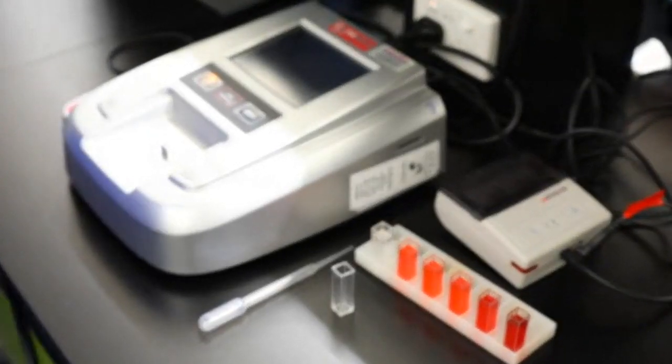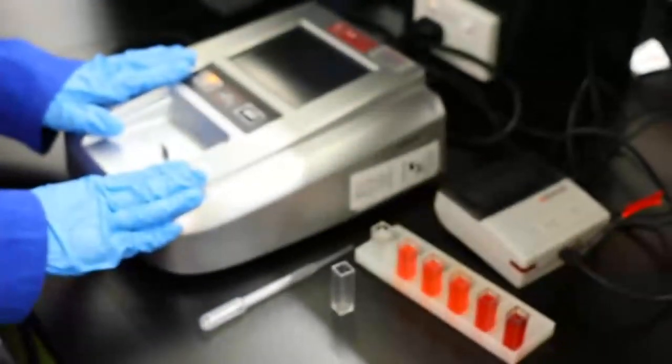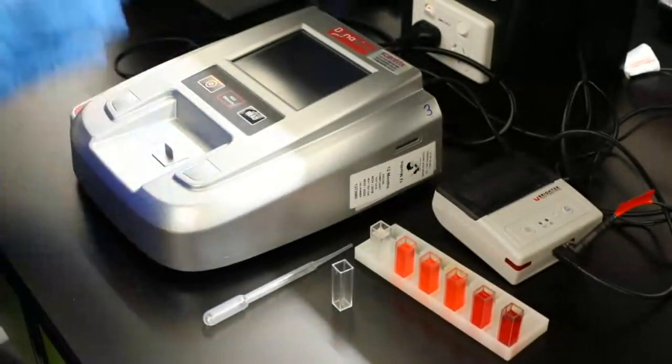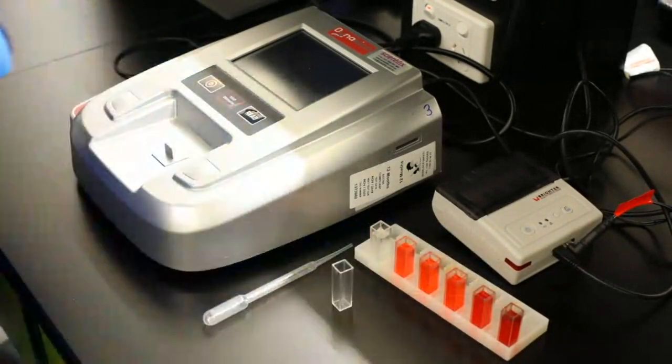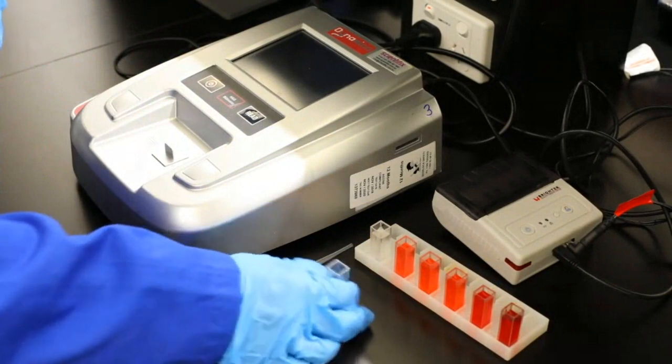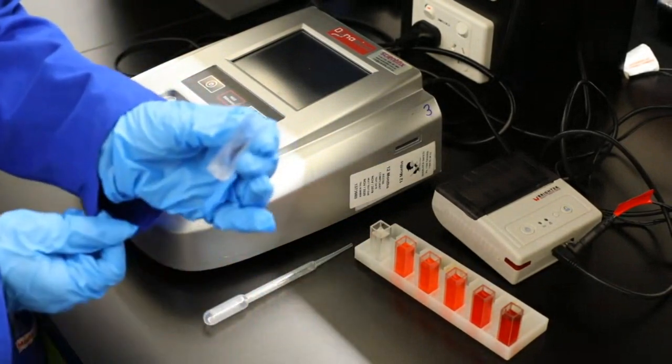Here we go. So here is our UV vis. I don't know if you have one of them, a bit smaller ones at school, like a colorimeter one, which you can see, as you can see, we've got a setup here with a nice color change. And how we actually use these is this tiny little thing here called a cuvette.